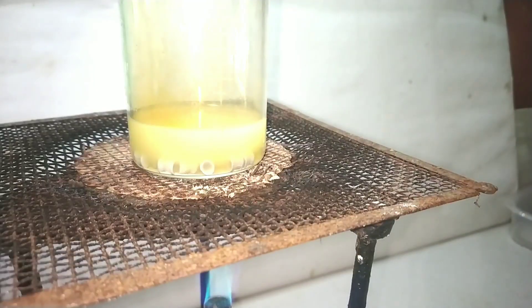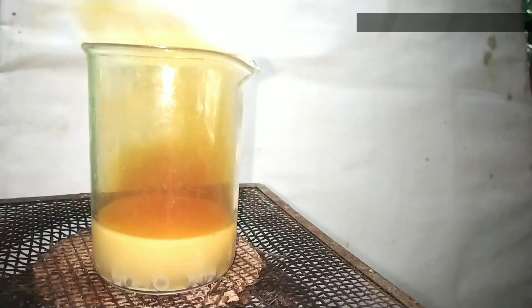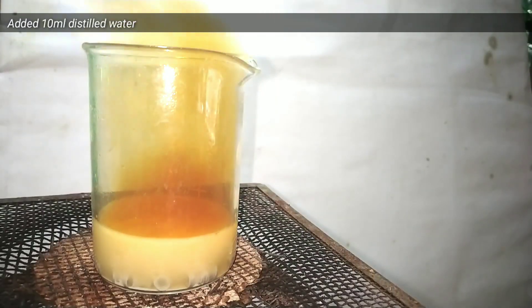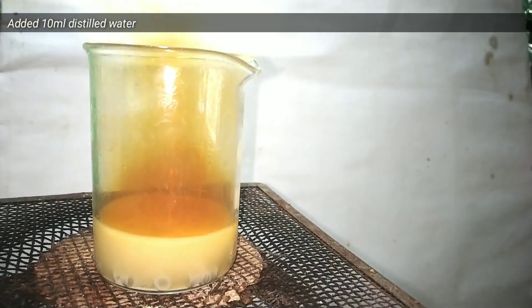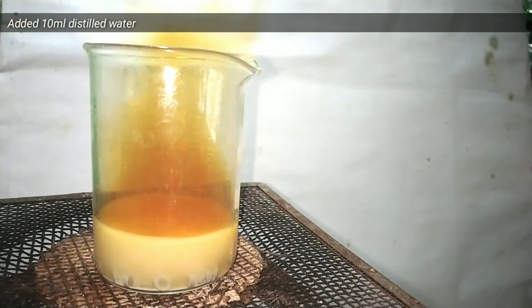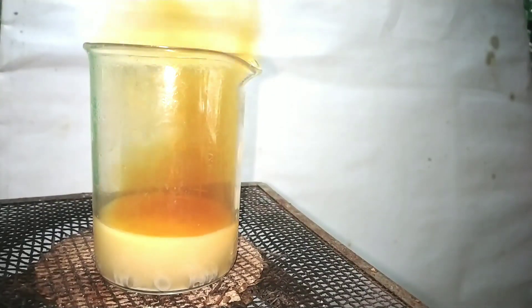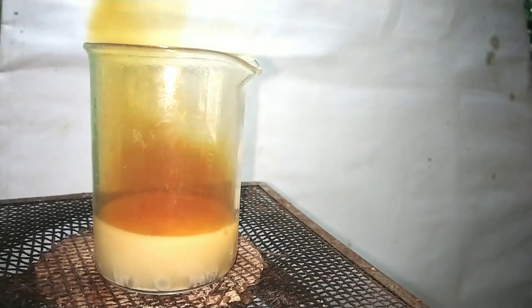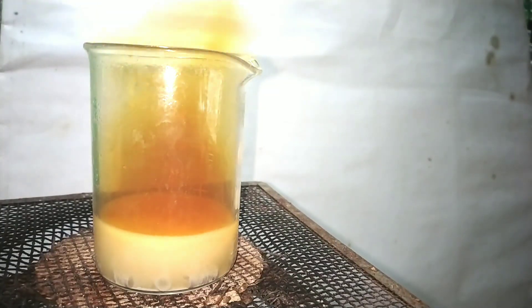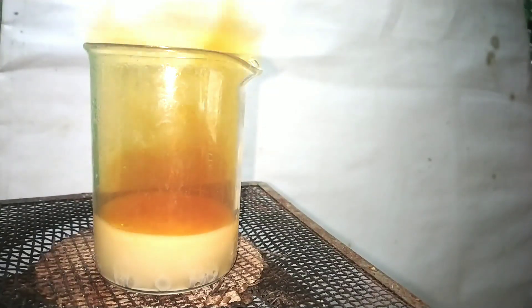Dilute nitric acid has much more action on lead metal than the concentrated one. So I added 10 milliliters of distilled water and continued heating. You can see that the reaction is getting pretty vigorous now, and a lot of nitrogen dioxide gas — that brown gas — is being released.